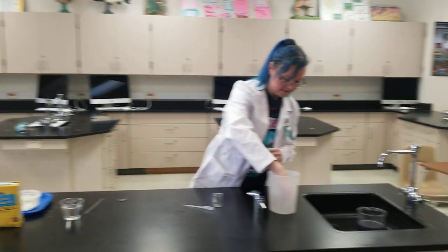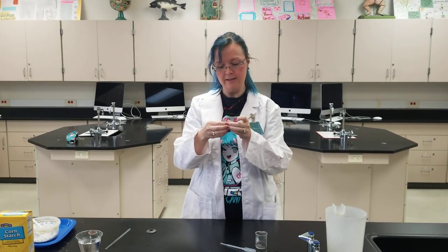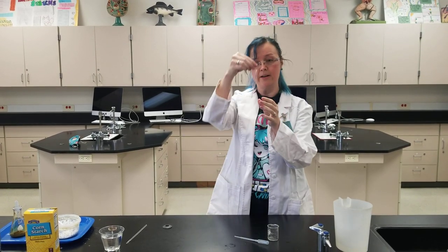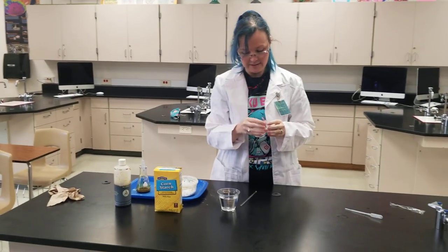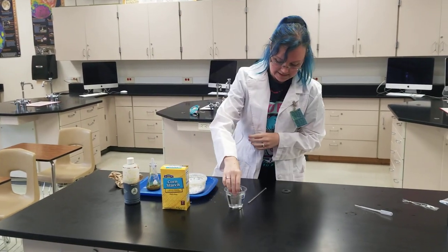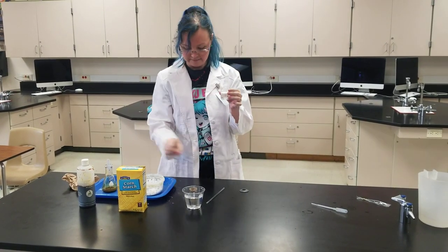So if we put the dialysis tubing in water, it becomes kind of pliable — it loses that crispiness. This is a tube, and I'm going to put some stuff in it. I'm going to first tie a knot in the end so that when I put stuff in it, it's not going to fall out the bottom. Now I have this opening at the top, and I'm going to prepare my solution. I've got some water here, now I'm going to add some water and take our starch and add it in and mix it up.